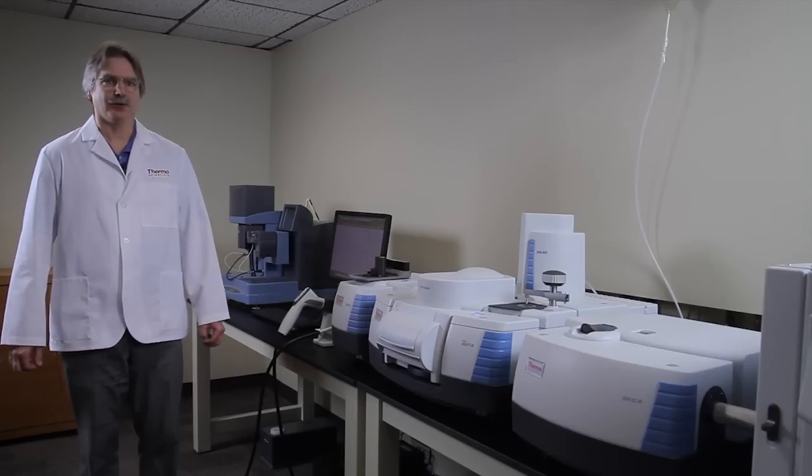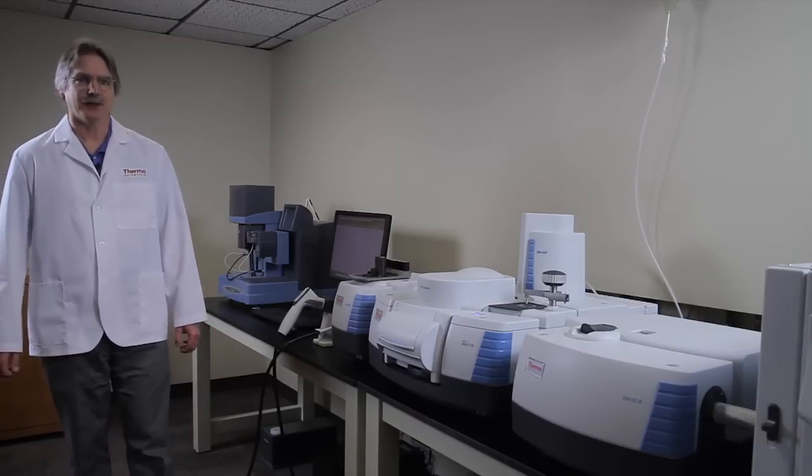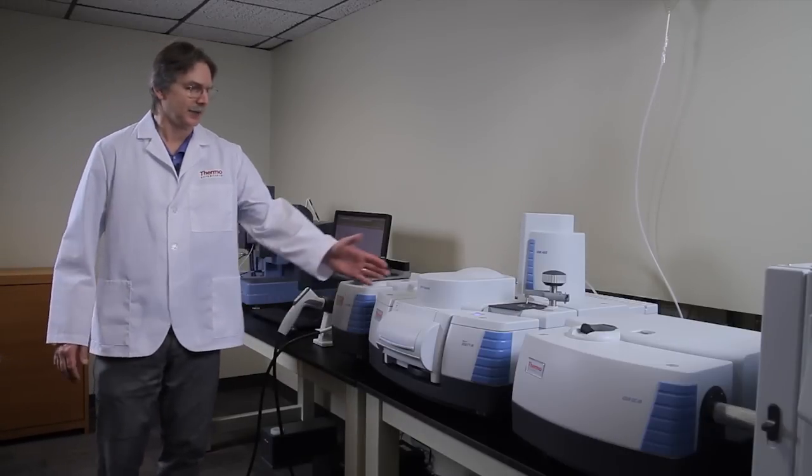Let me go ahead and introduce the instrument to you. First of all, it is an FTIR spectrometer. This is the main bench.